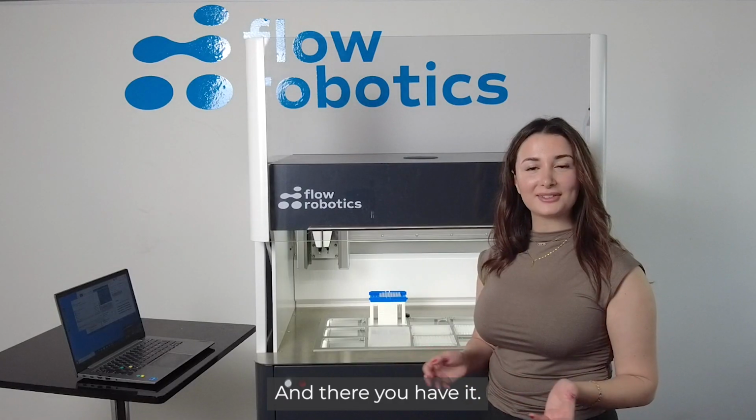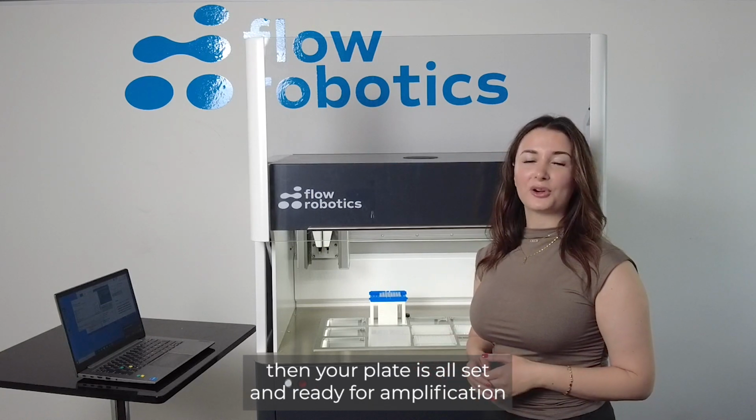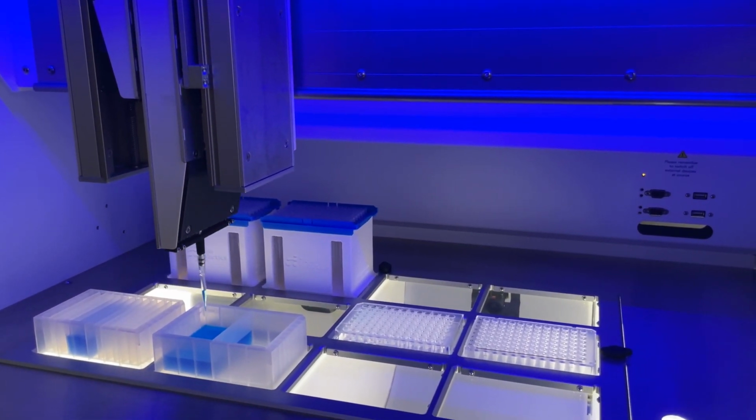And there you have it. When the flowbot 1 has completed all the steps, then your plate is all set and ready for amplification in a thermocycler.